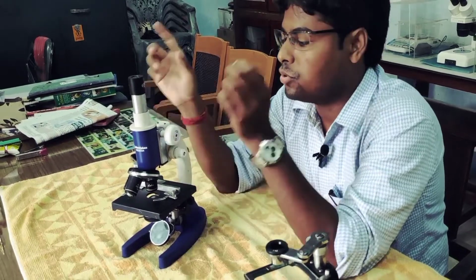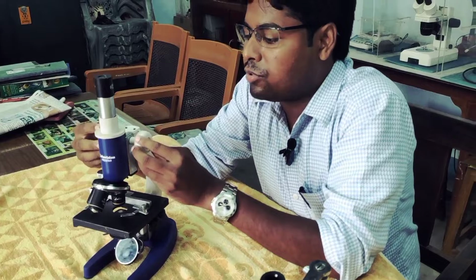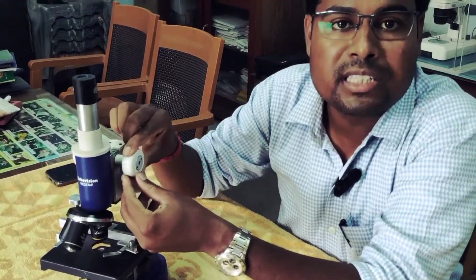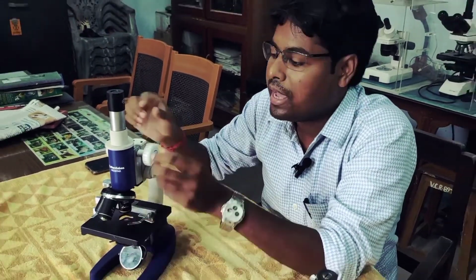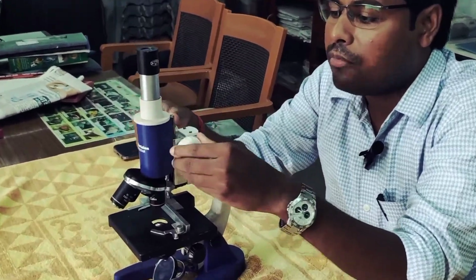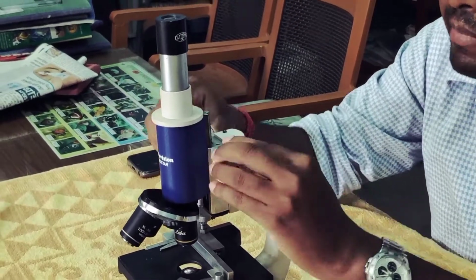Here are two important screws of this microscope. The large screw is called the coarse adjustment screw, and beneath the coarse adjustment screw there is a fine adjustment screw. We can use the coarse adjustment screw to move the body of the microscope up and down.